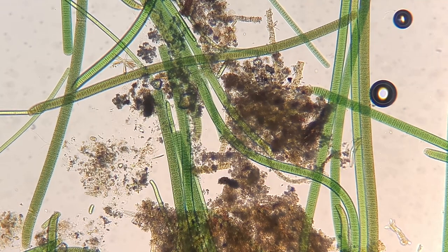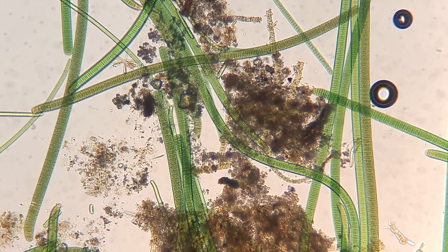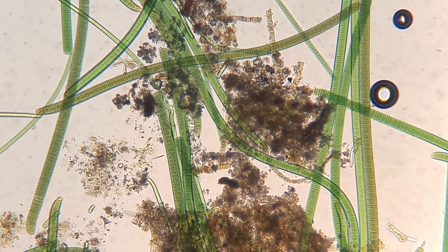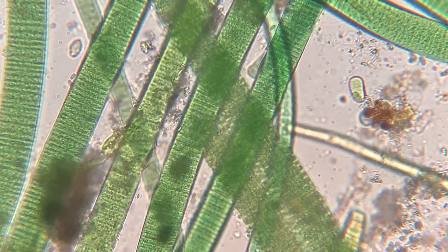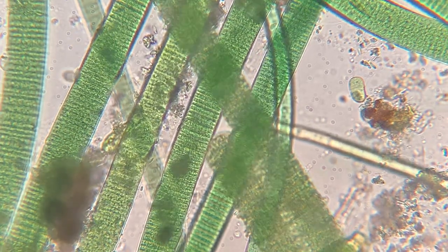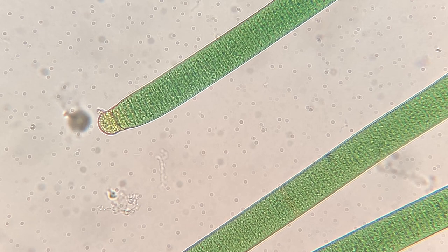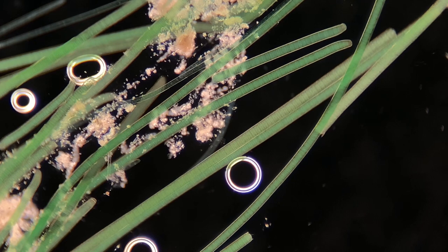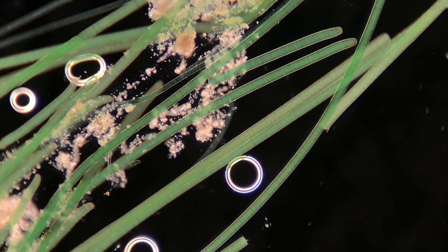The very first thing we're going to be looking at is this blue-green algae cyanobacteria. This particular species is known as Oscillatoria. It gets that name because it oscillates back and forth depending on where the light source is. This is a pretty cool thing that a lot of bacteria can do — it's basically how they get their nutrients. These guys are photosynthetic organisms, so they travel wherever they can find the light and do photosynthesis.